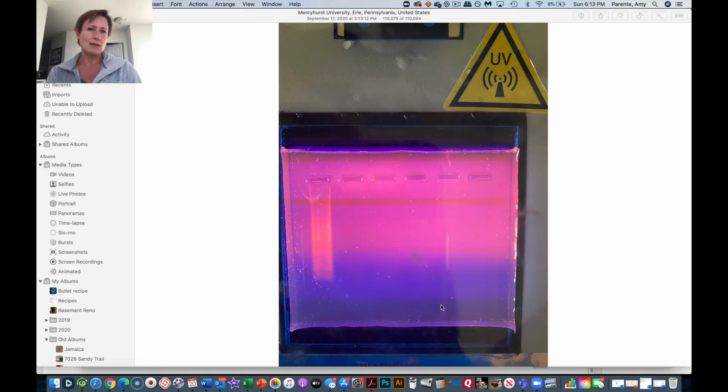So we're going to do the same type of process with both our agarose DNA gel that we had here, and then when we have our protein gel, we'll do that as well. I just wanted to highlight, maybe you can see here, there are some bands, but they're pretty faint. Our ladder was a little bit smeary here.